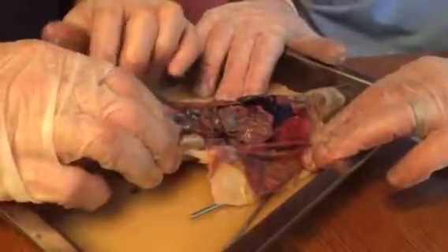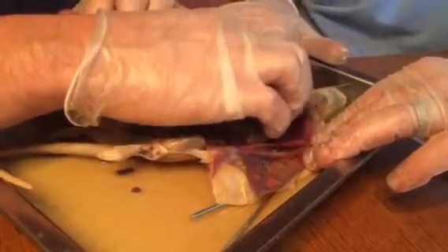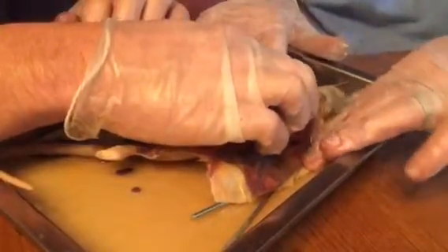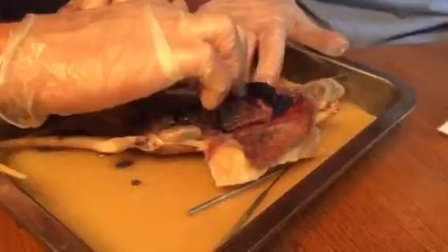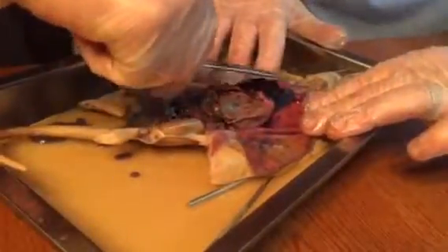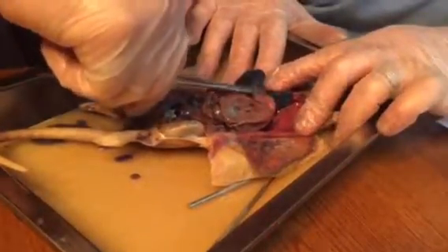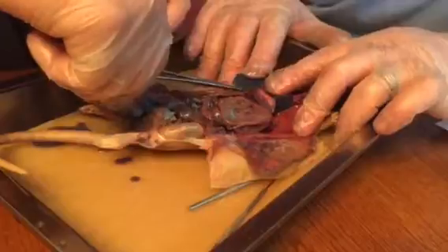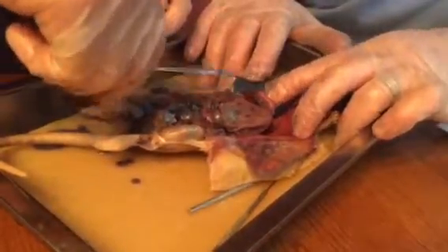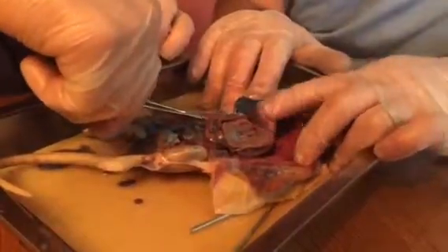All right, so we got our trachea and esophagus going down there behind the heart and lungs. Stomach is at the point. What's this guy right here? The stomach? That's the stomach, right next to the liver. This is called the ligament of Treitz. Yeah, nice. That's cool.